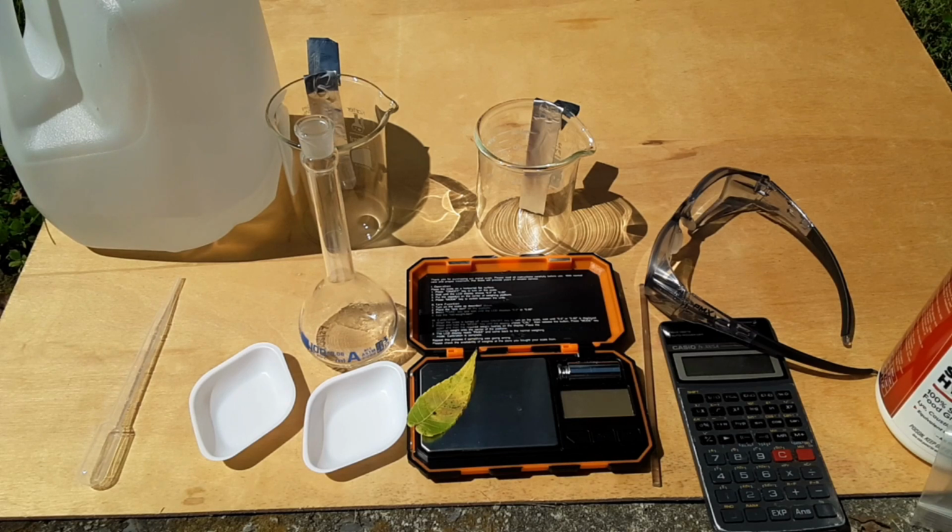But sodium hydroxide is something that's found in drain cleaners. It's not a nice chemical by any means. It's something you don't really want to mess around with, to be quite honest with you. Potassium hydroxide seems to be slightly worse, in that it's a stronger base than sodium hydroxide. I don't have any experience with potassium hydroxide, other than to say it would make sense that it's probably worse than sodium hydroxide. But anyway, today I just want to make two solutions here and compare the two to see if there's a difference in the reaction with the aluminum.